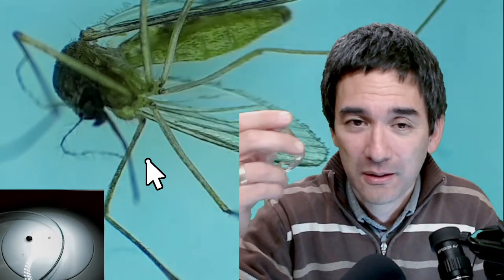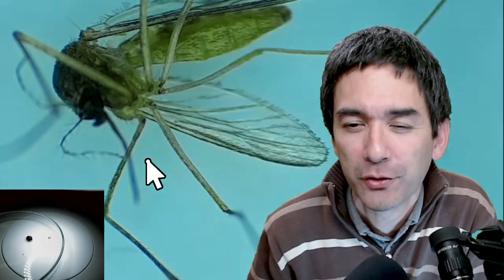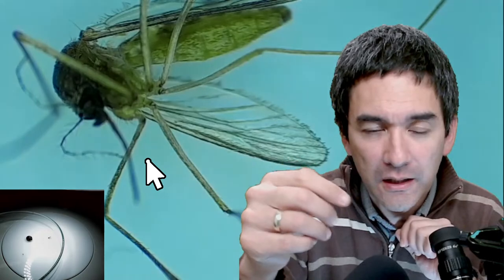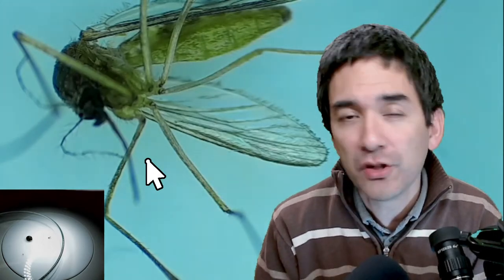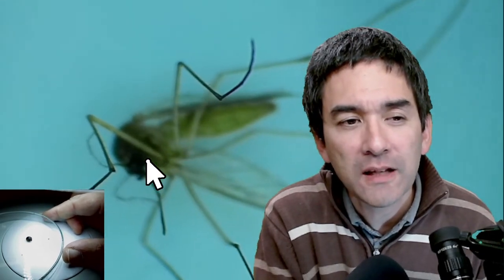On whether stereo microscopes have a movable stage: not necessarily. A mechanical stage with knobs to move the slide precisely is often not needed because the magnification isn't high enough to require that precision — you can just move the object by hand.